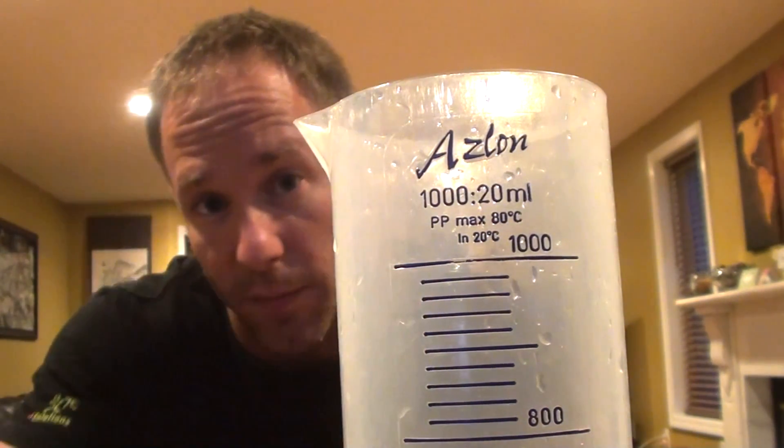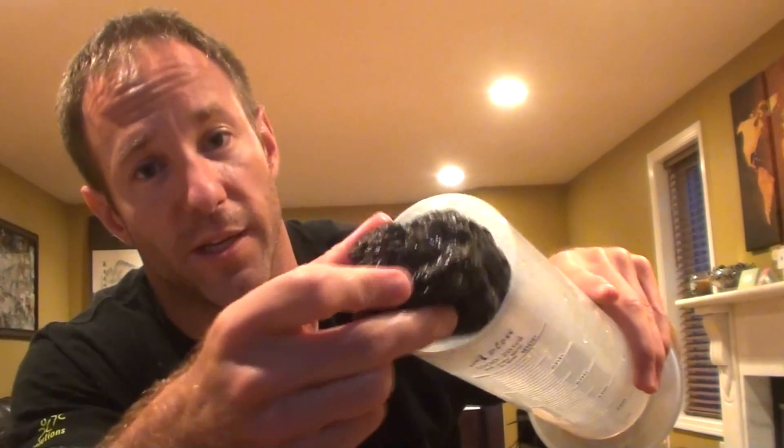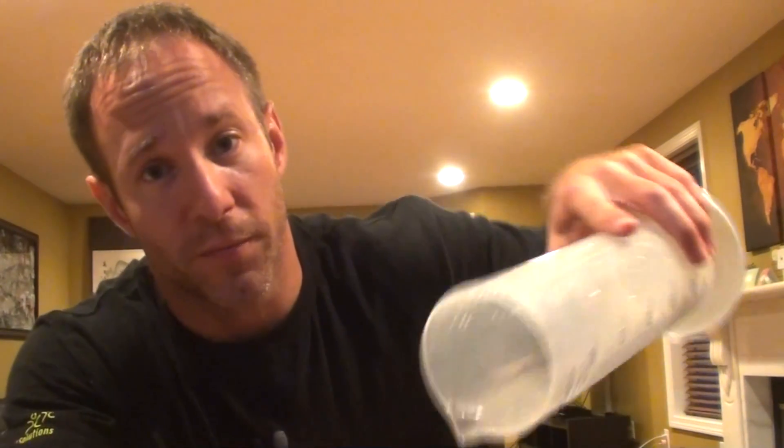To do that, I need to have a graduated cylinder. When you get a graduated cylinder, you always want to use the smallest cylinder you can — it's going to be the most precise. However, you don't want it to be so small that the object gets stuck. This here is a 1000 milliliter graduated cylinder, and the precision — it tells you at the top — is 20 milliliters, meaning each little line goes up by an interval of 20 milliliters. I've already checked, and this rock is not going to get stuck, so this would be a good graduated cylinder to use.